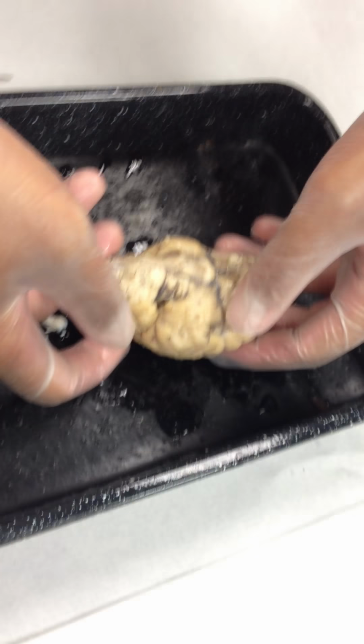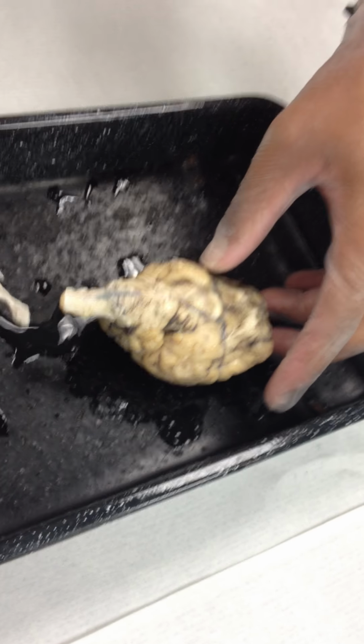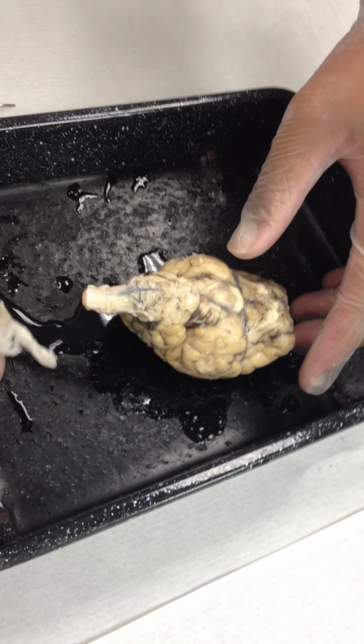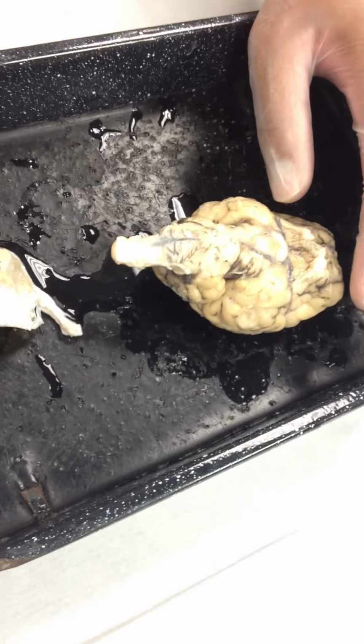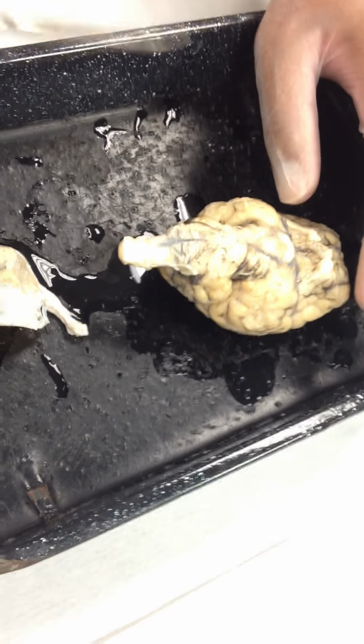So, with these ones, we didn't take them off, and you can see that we got them like this, and whoever took them off, they just had to yank that membrane off. There'll be several pairs of nerves that are anchored to the membrane. What's gonna happen to these cranial nerves? You just yank it off. You're gonna break them away from the membrane. You have to locate those first and be very careful to clip them away from the membrane before you remove this. They're small and fragile, so we don't have very long ones like you see here. They're gonna be pretty short because of the way that membrane was.